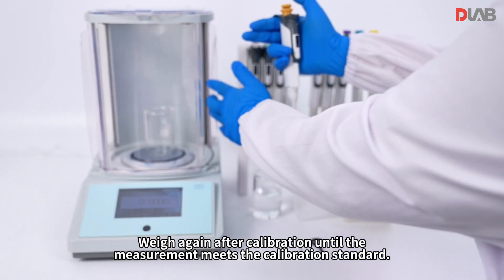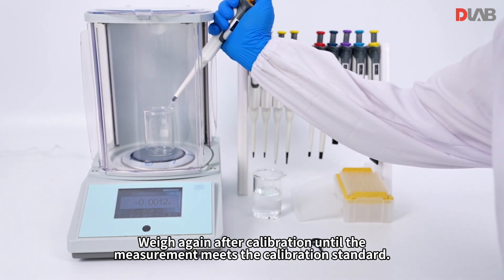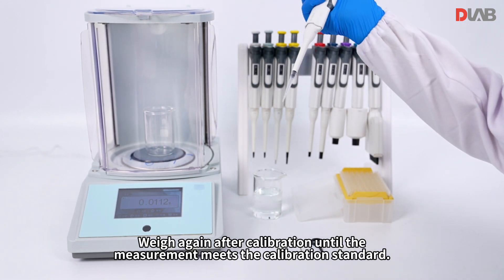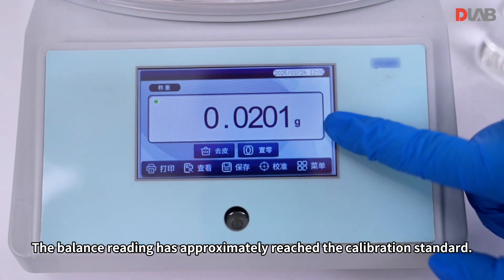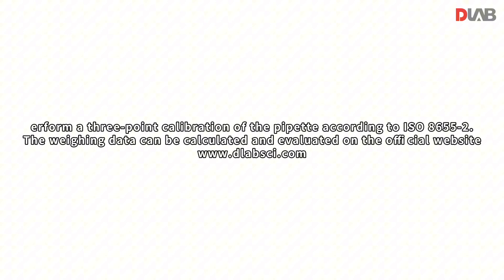Weigh again after calibration until the measurement meets the calibration standard. The balance reading has approximately reached the calibration standard. Thank you.